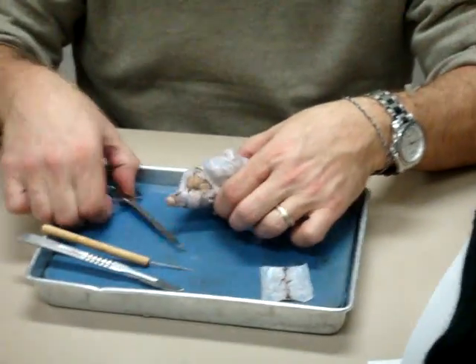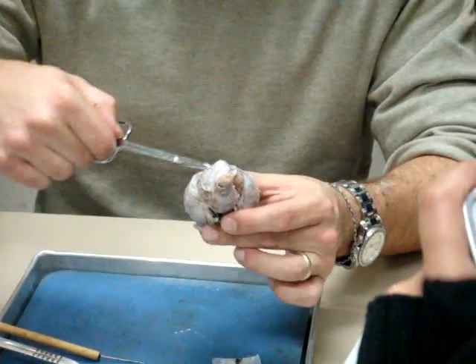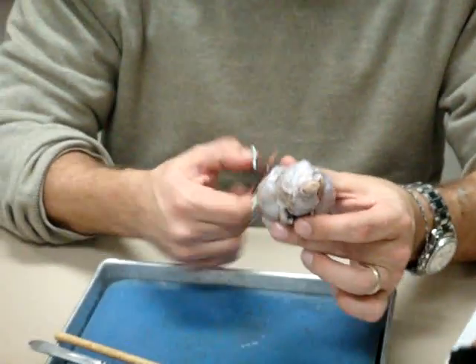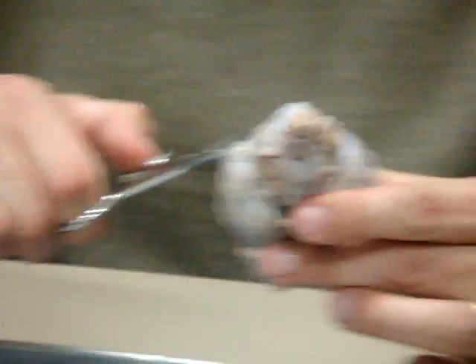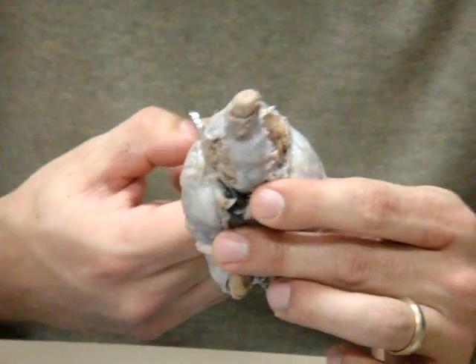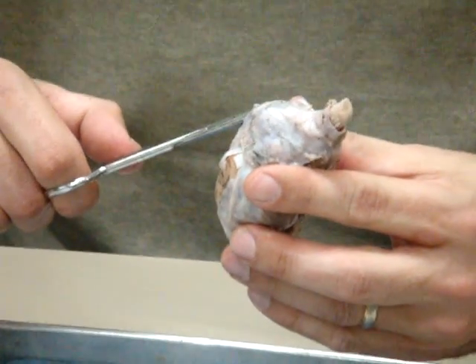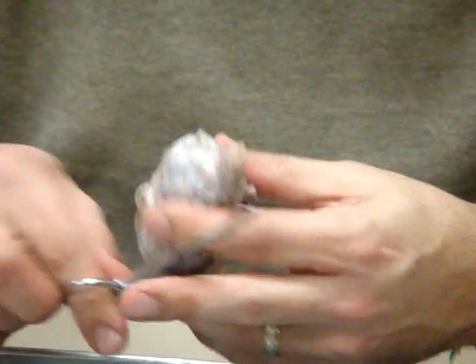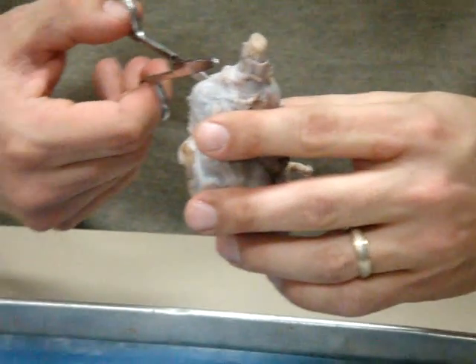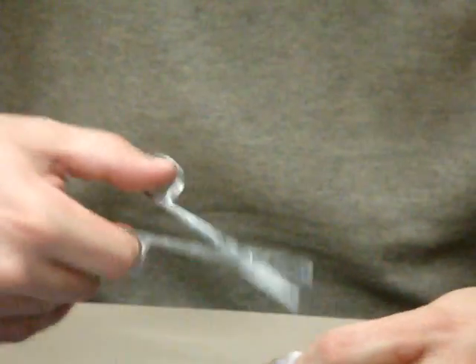Now, I can show you this if I continue back, and you've got to be careful with this part. I would use the blunt end. This is a lot thicker. The transverse sinus and the tentorium cerebelli are a lot thicker. So I've got to get in there and then sort of get underneath that tissue and give it a snip like that. And I'm going to do the same thing on this side. Carefully getting underneath that area, and then I'm going to snip.